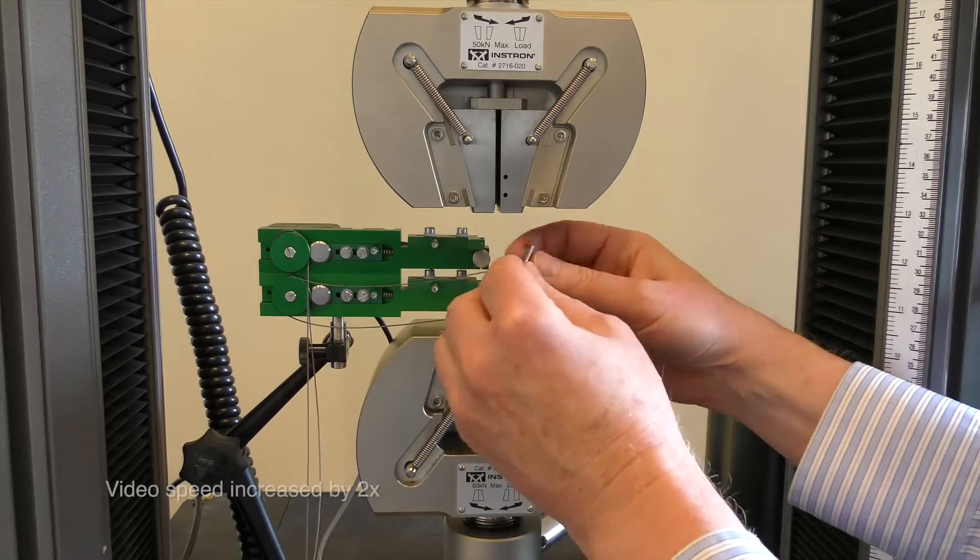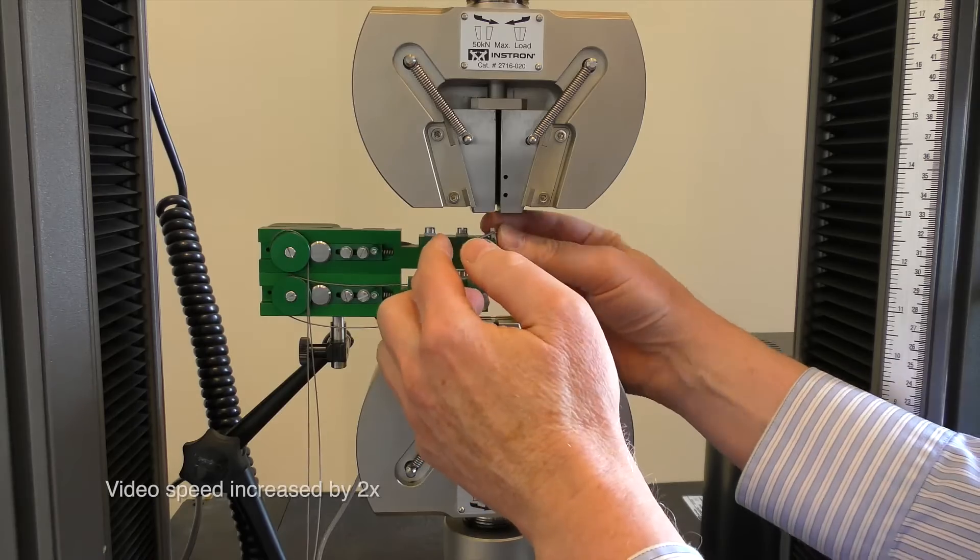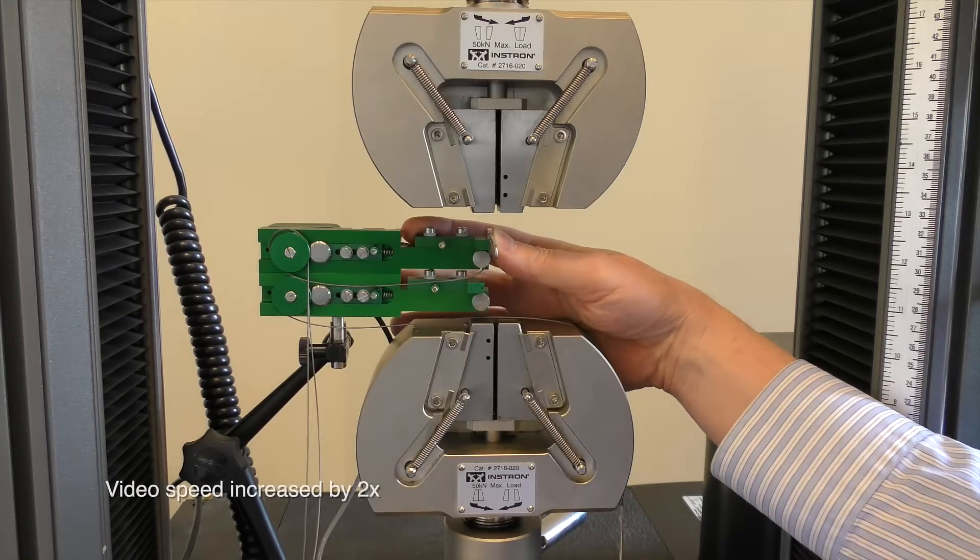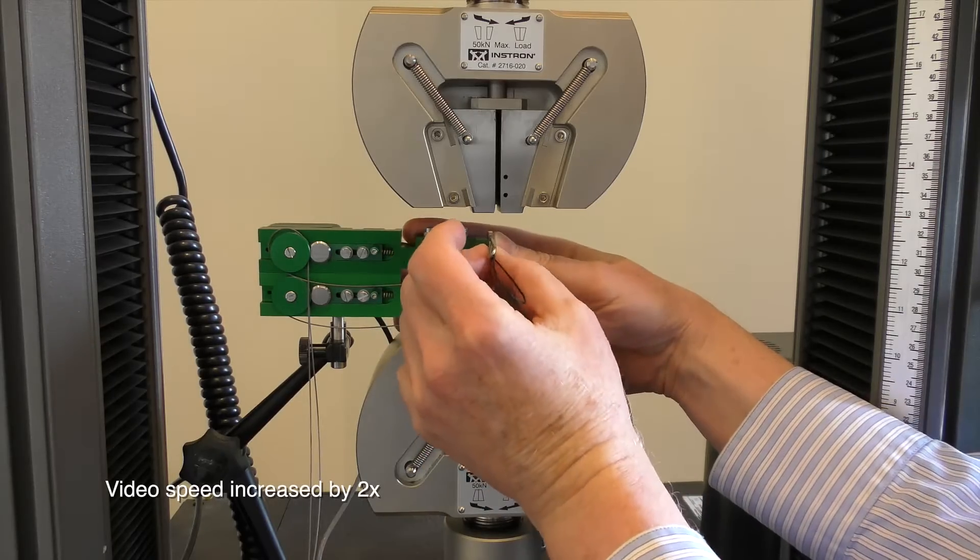To prepare for the next test, retract the cables, return the sliding positioners to the positions closest to the specimen and insert the zero pins.